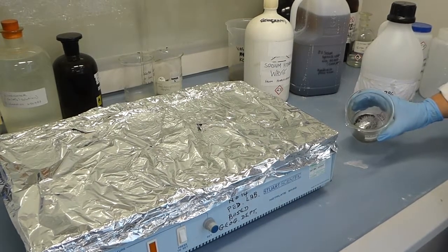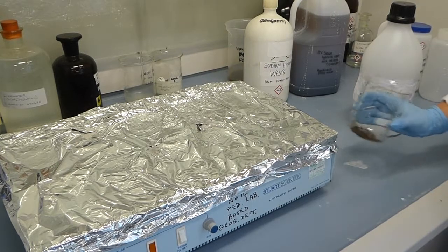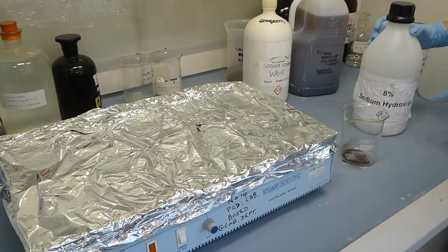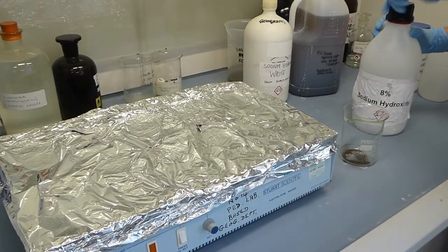To begin, you need to weigh out accurately 0.2 grams of your sediment into a beaker and then add 100 ml of 8% sodium hydroxide solution.